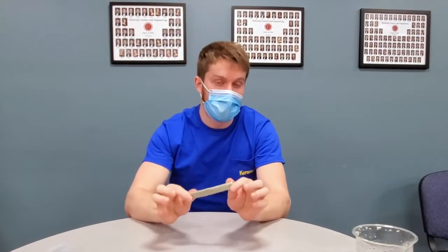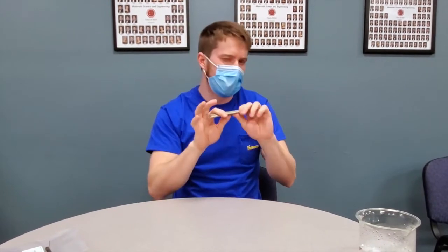So another cool demo of metals is the example of something called screaming tin. So tin, when it crystallizes or solidifies from a melted state, it actually starts twinning. What twinning means is that two crystals share the same lattice point and can grow over each other. So the result of that is that when you put dislocations through the material, it actually shears off those twinned crystal lattices, and you can hear the sound when you bend tin. It sounds like a crackling, kind of high-pitched popping sound. But I'll put it next to the phone and see if you can hear it.